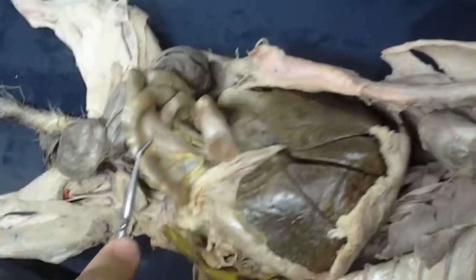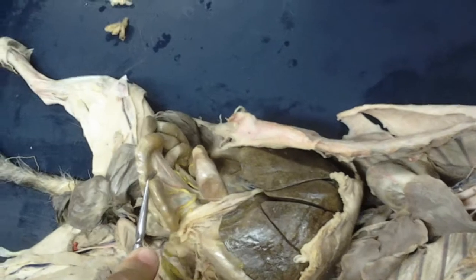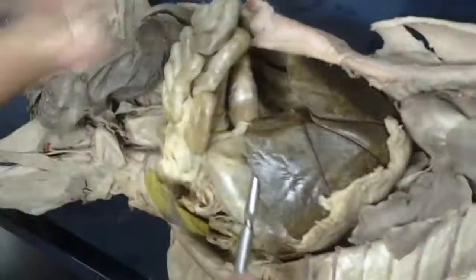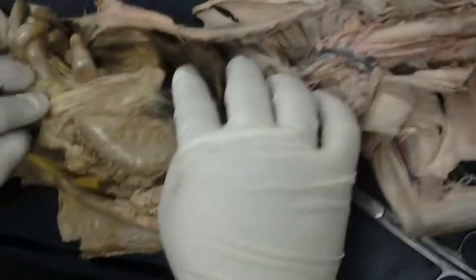Do you want a napkin or a glove? Just a glove would be good. Do you want me to open it? We're good. We can see it right here. Let's see. There we go. Right there. Yeah, I'll take those gloves. Really get in here, right?